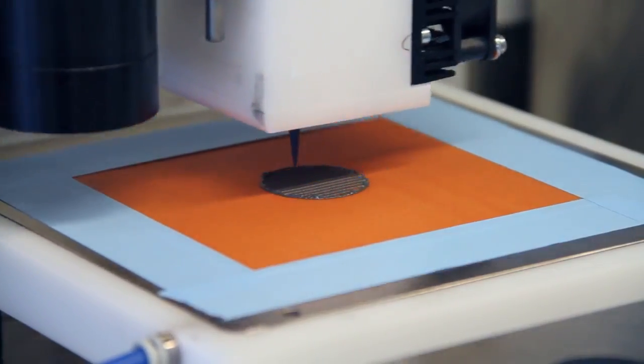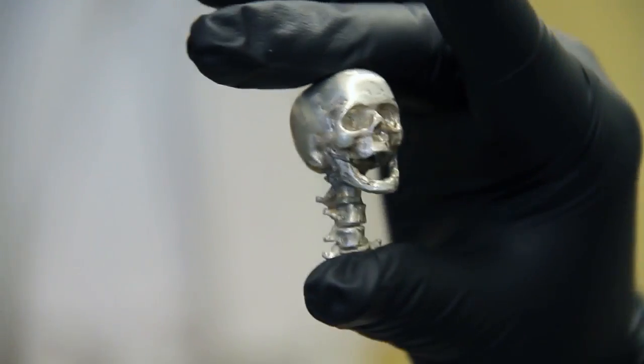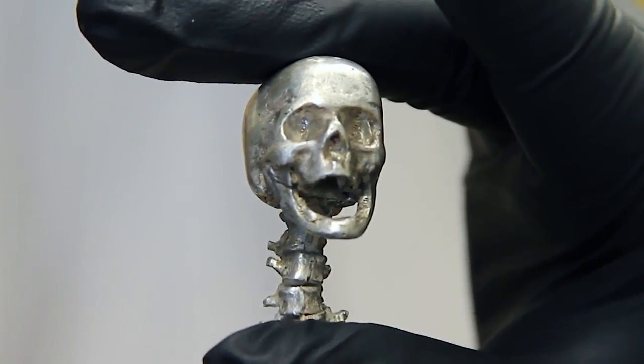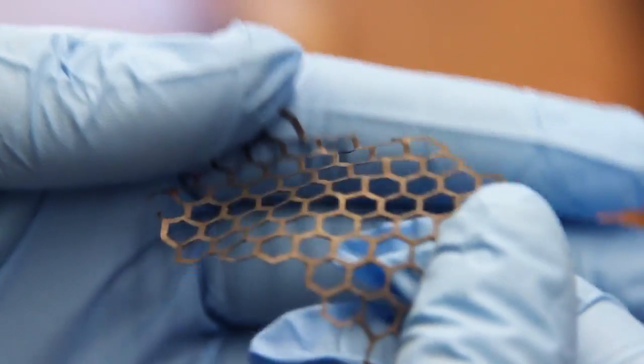The ultimate objective and goal of my lab is to develop systems that end with 3D printed products that can be accessible to many people. That's important, especially in the biomedical realm, where cost makes a huge difference. So this is truly the ultimate goal, and really 3D printing and additive manufacturing is to make a universal material method, and you can print anything you want. It really lowers the cost, increases the complexity and versatility of what can be 3D printed, and the Bioplotter does allow us to be able to do that.